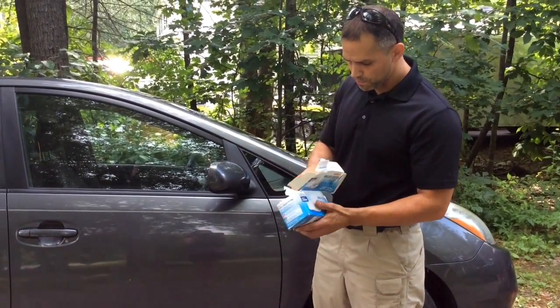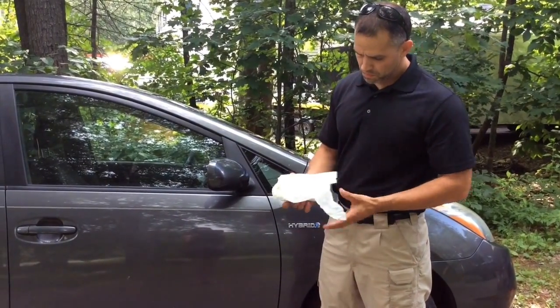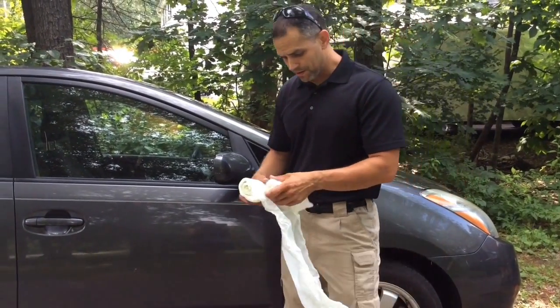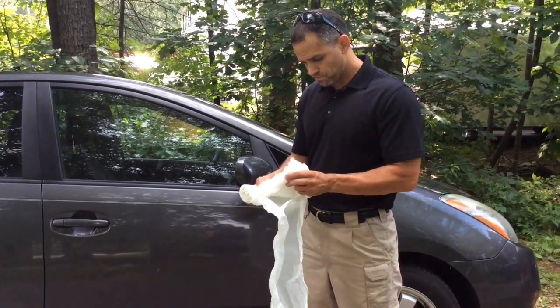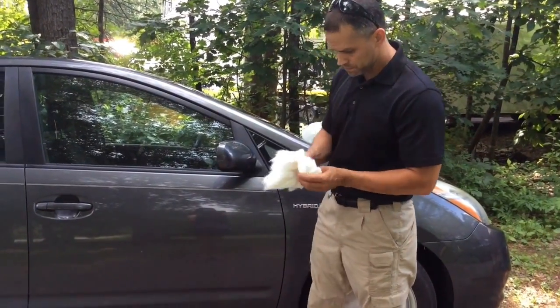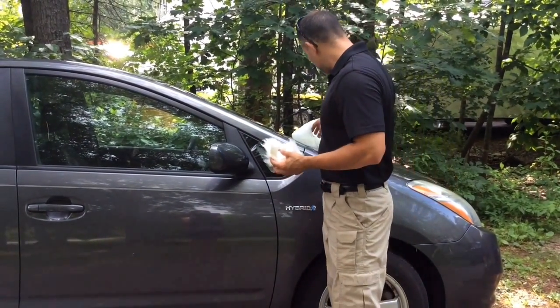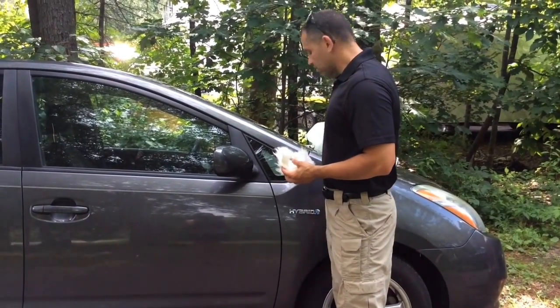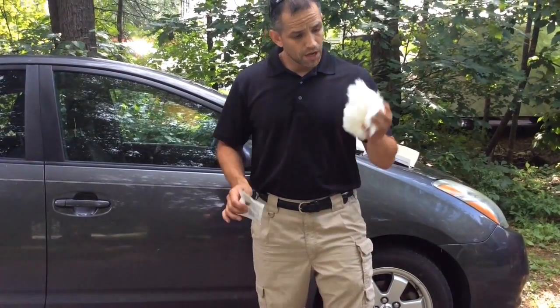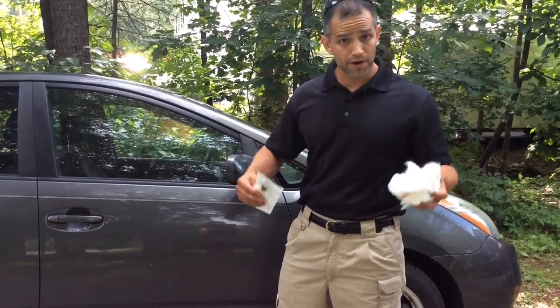So what we're going to do is I'm just going to open this up. Now the rolled cotton is just that — it's like a giant cotton ball that you can tear off. So I'm just going to take a big giant piece of the cotton and I'm going to fluff it up nice. Now, if this car potentially had DNA on it, we would need to use a disposable brush. We're going to do the same. Once we use this cotton, we can dispose of it and just get more — it's really cheap.